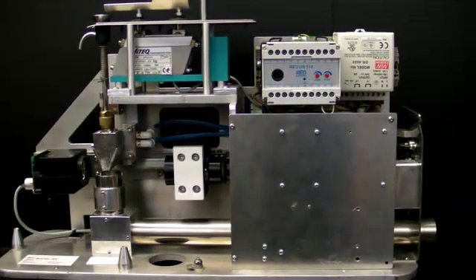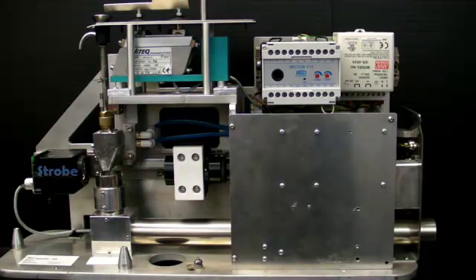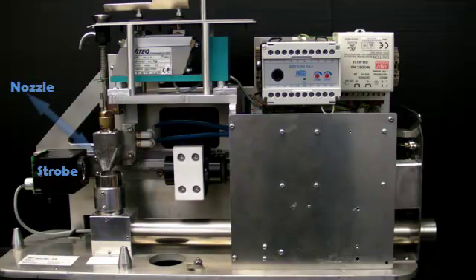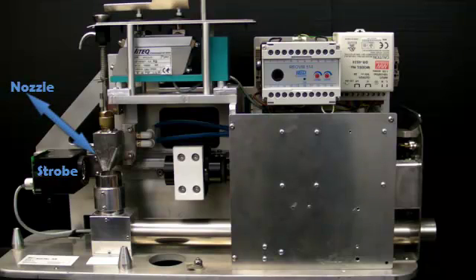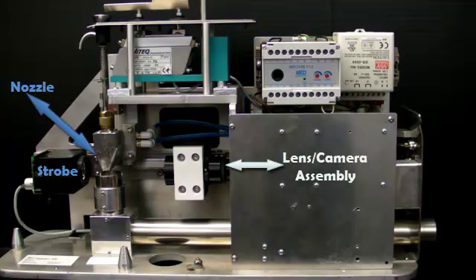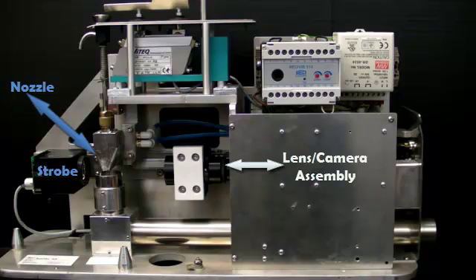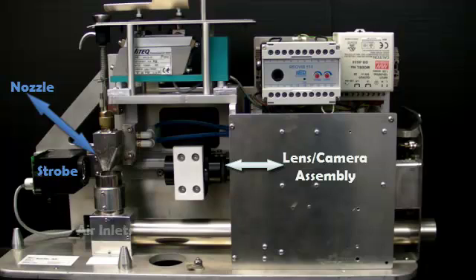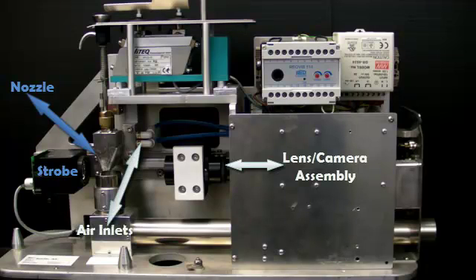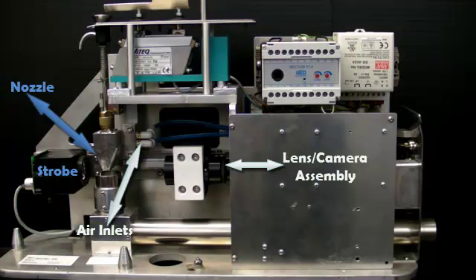Here's a view of the internal components of the DIAF. To the left side center is the high speed strobe lamp for illuminating the particles as they exit from the jet nozzle at the bottom of the feed tube. The lens camera assembly is shown to the right of the nozzle. Three different overlapping ranges are available for the DIAF. Just to the right of the nozzle are air inlets for supplying pressure to the sample stream as it enters the nozzle.